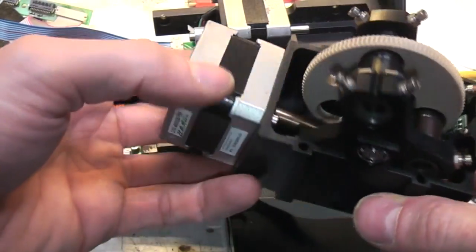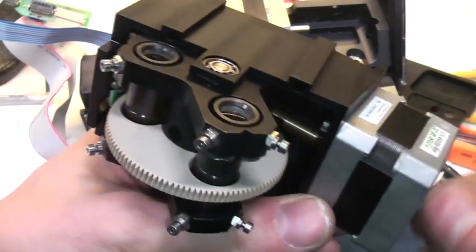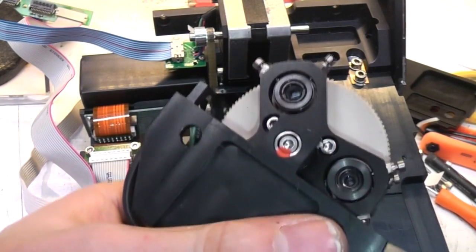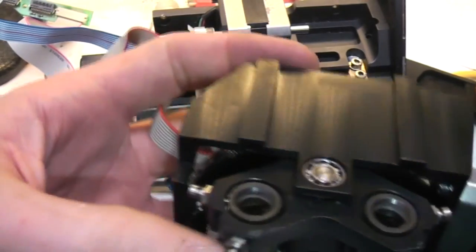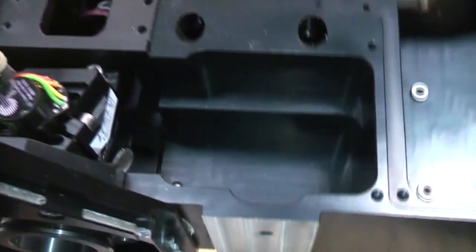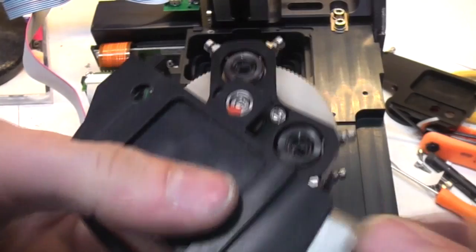And you've got this assembly which rotates one of three optical assemblies. There's a multi-lens assembly that may be perhaps collimators or something. These are sort of precisely alignable on both ends. You can see the alignment screws are accessible through those holes. Even so, it's probably a bit of a fiddly job to align that, I would imagine.